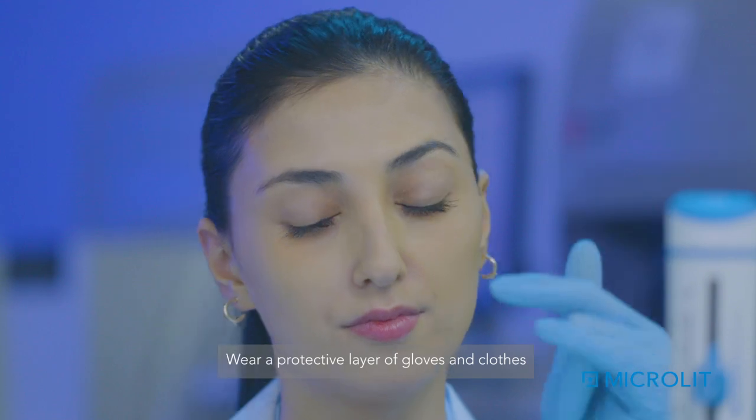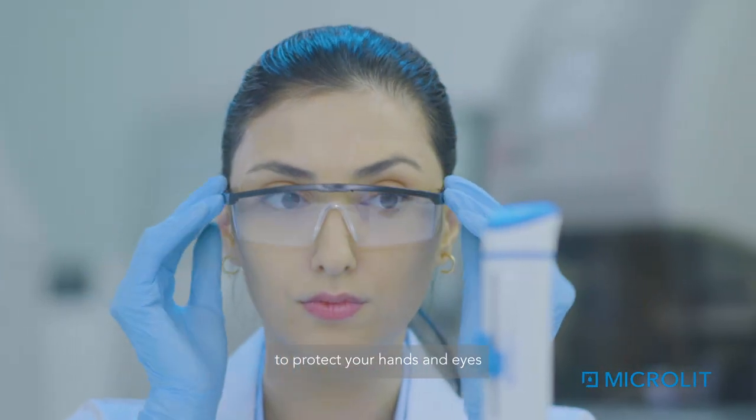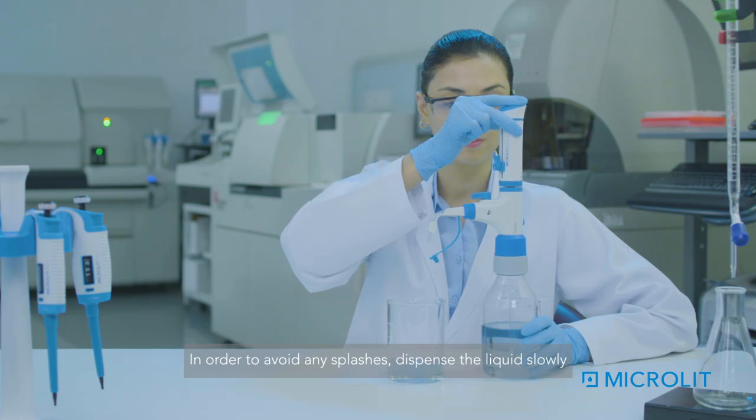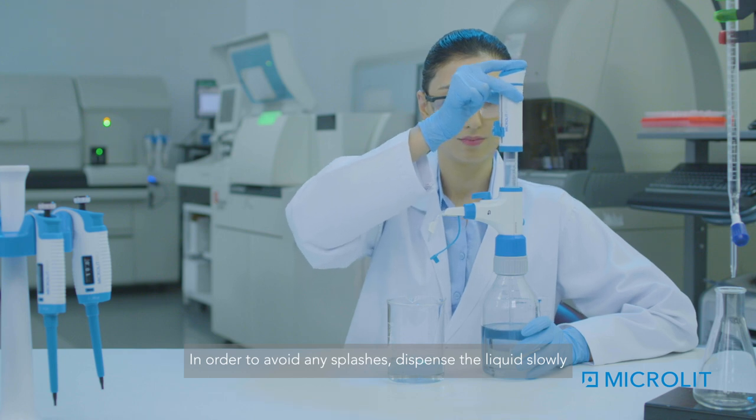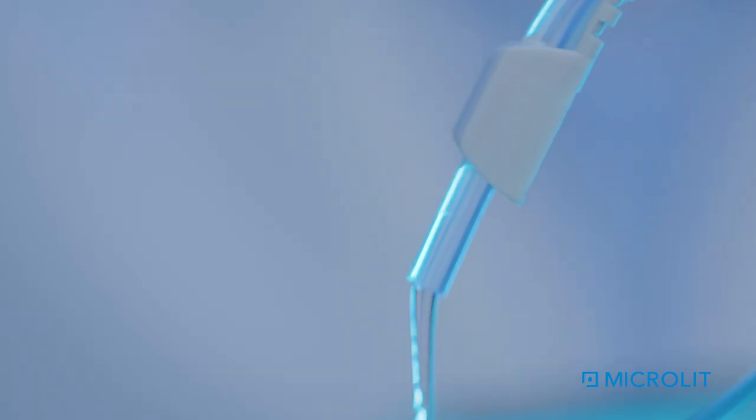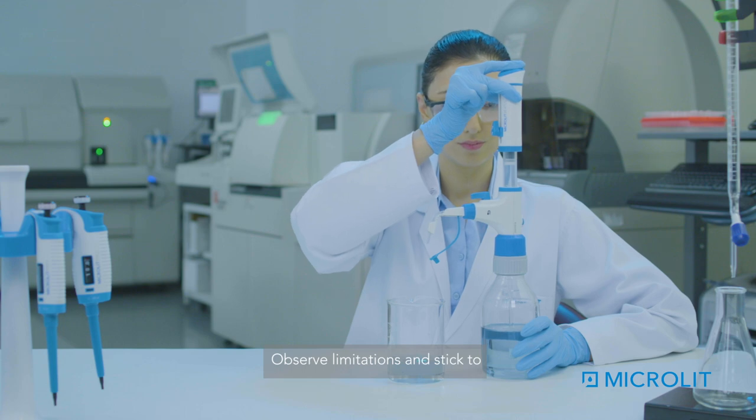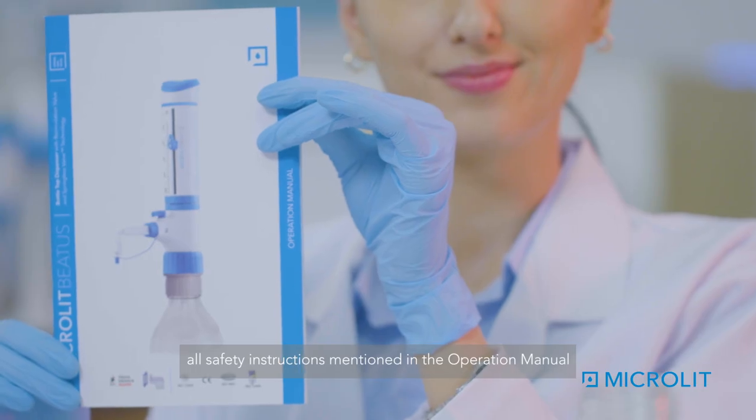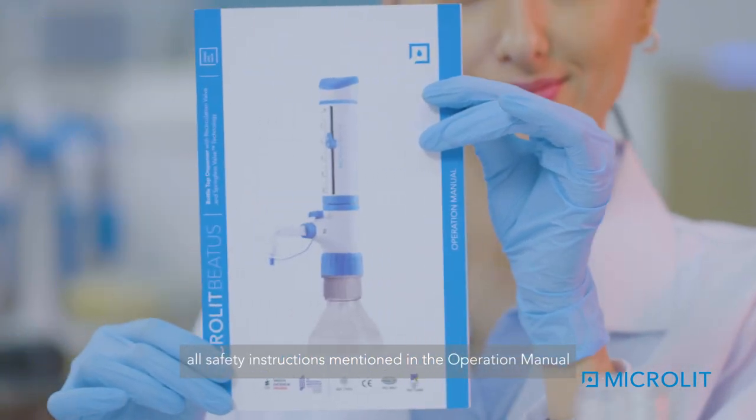Dispensing. Wear a protective layer of gloves and clothes to protect your hands and eyes. In order to avoid any splashes, dispense the liquid slowly. Observe limitations and stick to all safety instructions mentioned in the operation manual.